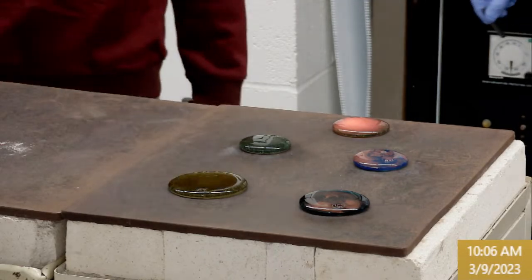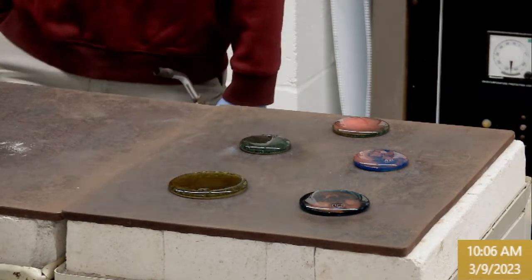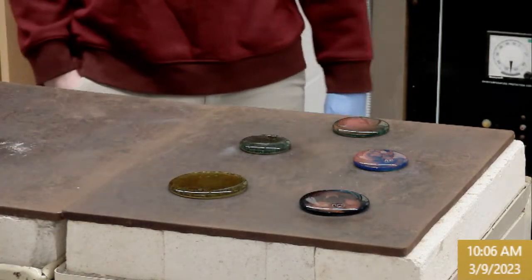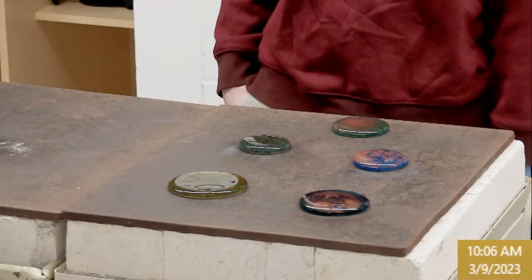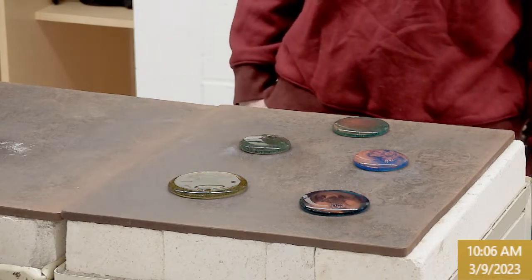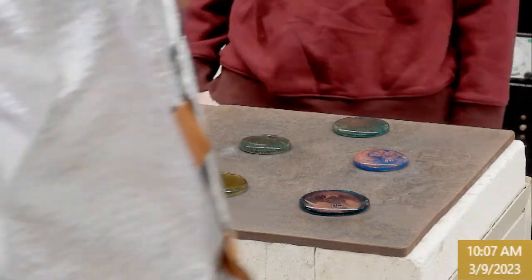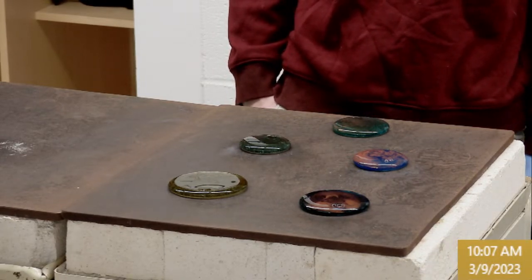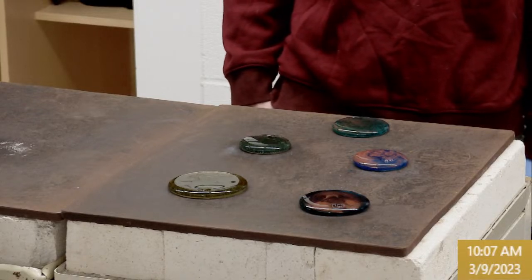All right, so that's mission accomplished on pours here. So now we have a little bit of a waiting game because you can't touch that, MC Hammer style. It's way too hot. That's an interesting color right now though, kind of a turquoise green. Yeah, it's slowly changing. Now we did have some that shattered last time, so what I'm gonna do is call out an approximate diameter without touching it, just to get something just in case.